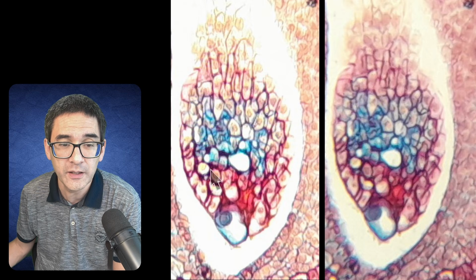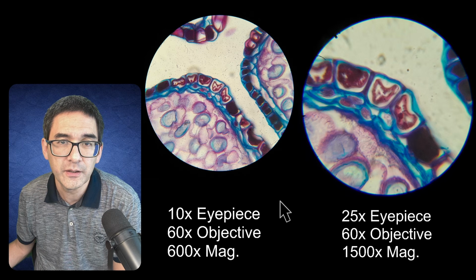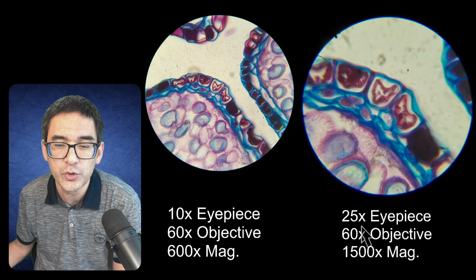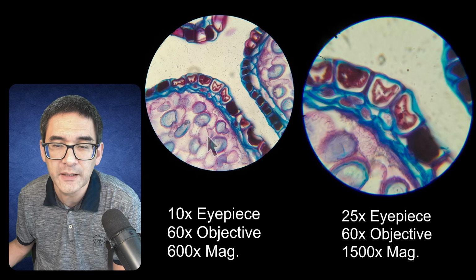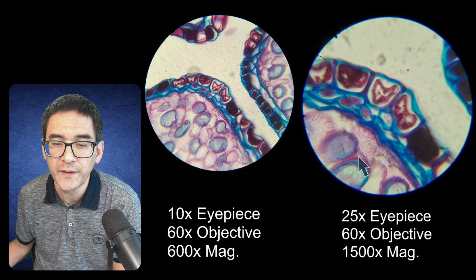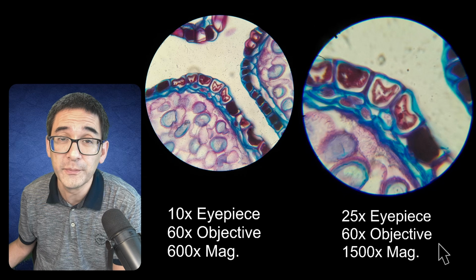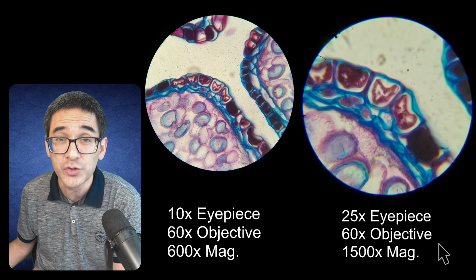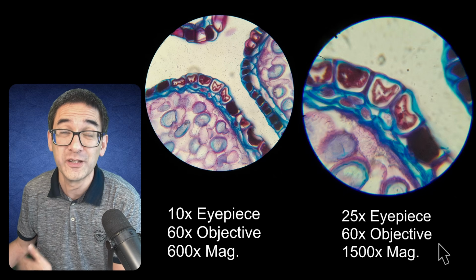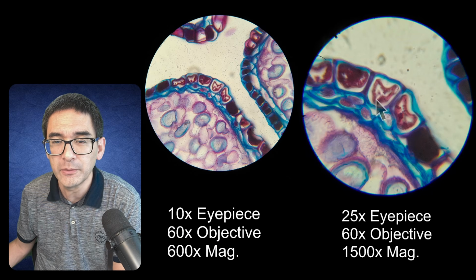However, I have actually tried something else as well. I now tried to keep the objective the same. So I used the 60 times objective in both cases, and now here on the left side I've got a 600 times magnification, and here on the right side I have a 1500 times magnification. Well, generally there is the rule of thumb that anything magnified above 1000 times is so-called empty magnification, so that we're not gaining any details. It just looks larger but blurrier, right? But we actually are able to see that.